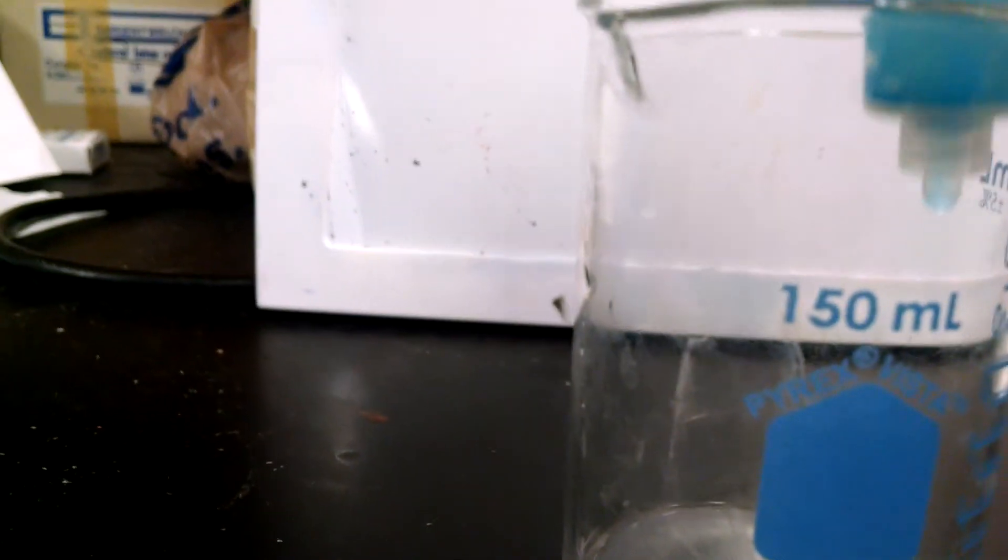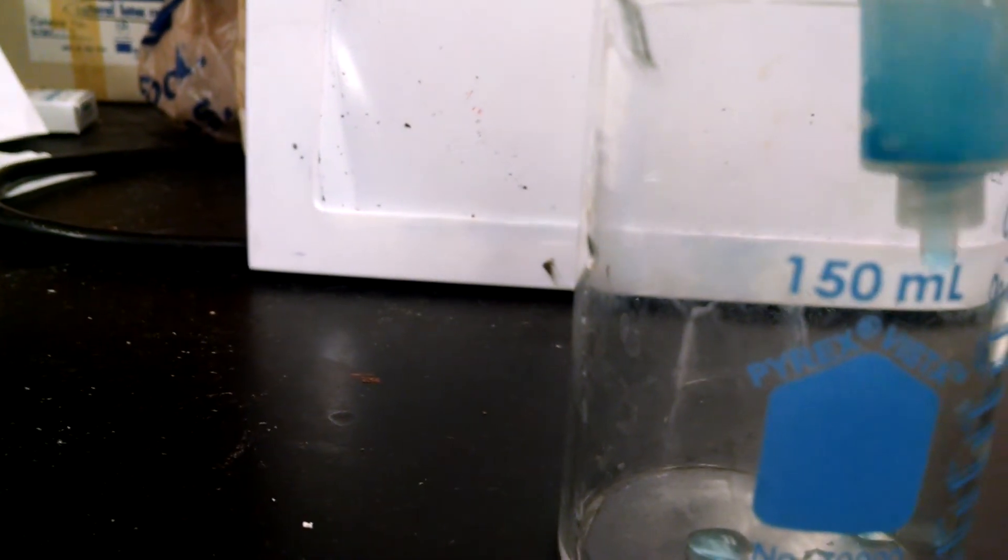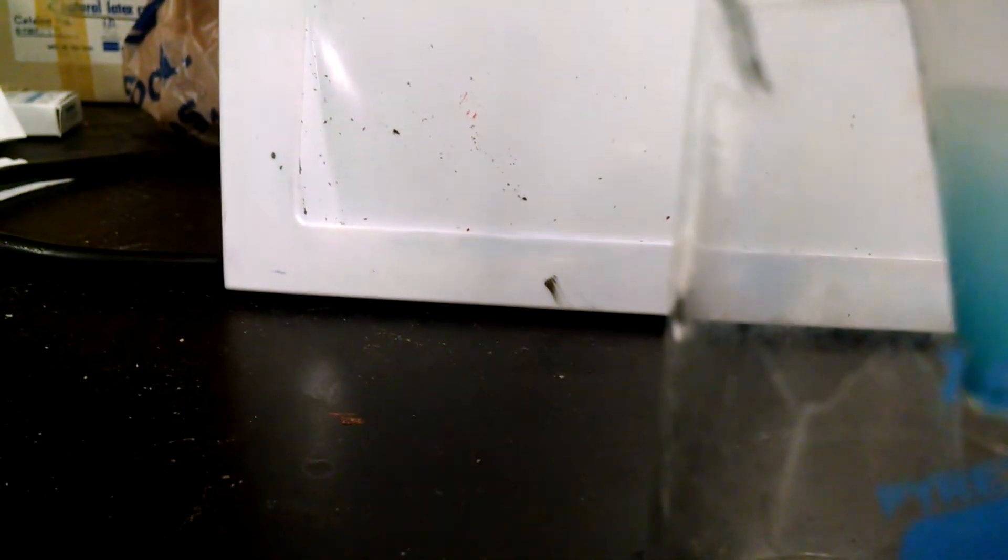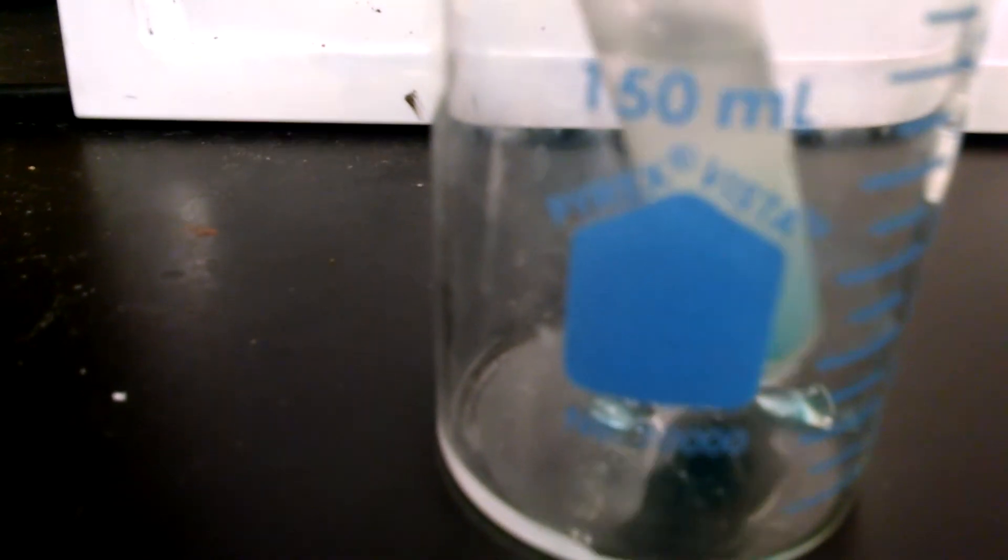What I'm going to do again is I'll push that solution through and we'll be able to collect all of the blue coming from that. And you can see right now that the blue is starting to drip out as I gently push the solution through. And I'll pause the video again and you'll see in a couple minutes what it looks like.